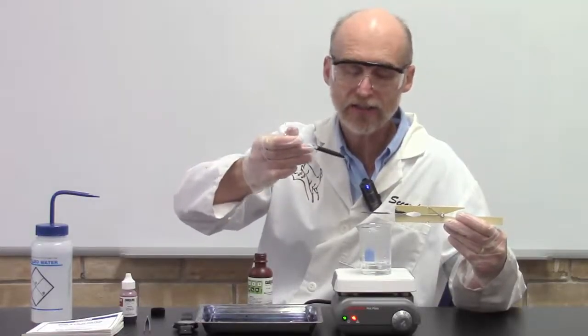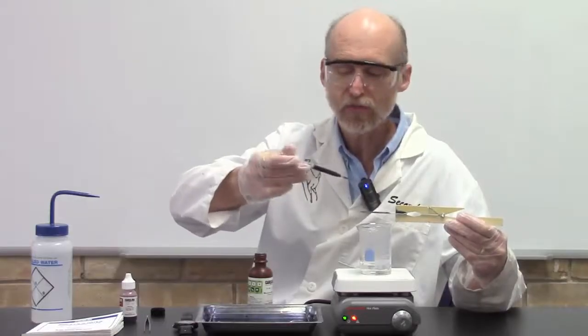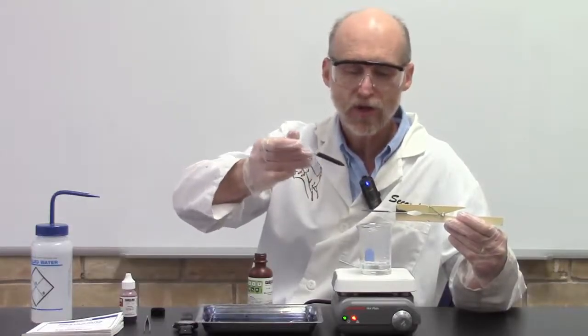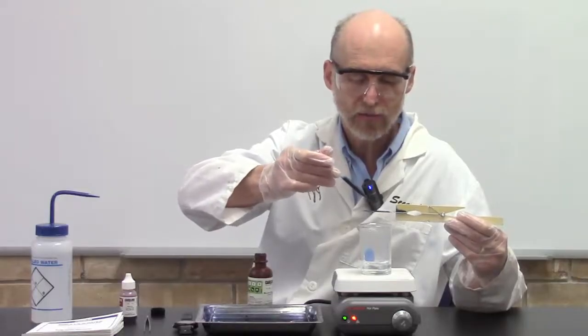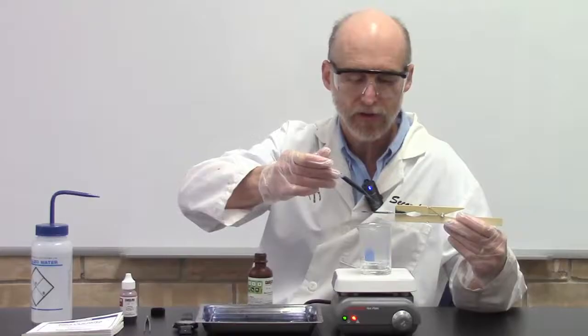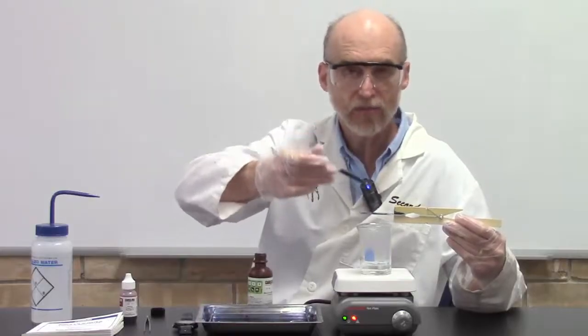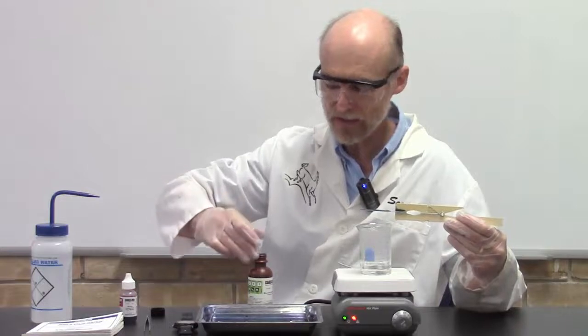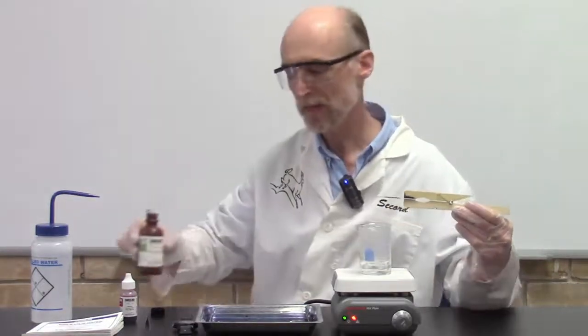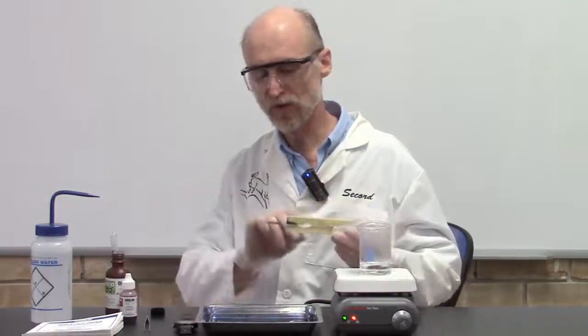Just keep watching it and make sure that it doesn't dry out, because if it does dry out, it's going to stick to the slide and your finished product won't be very good. So as necessary, add more malachite green just to keep it moist. Now after three minutes of steaming malachite green into your bacterial smear, then you're ready to rinse it.